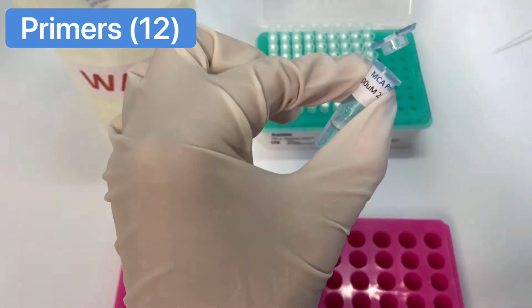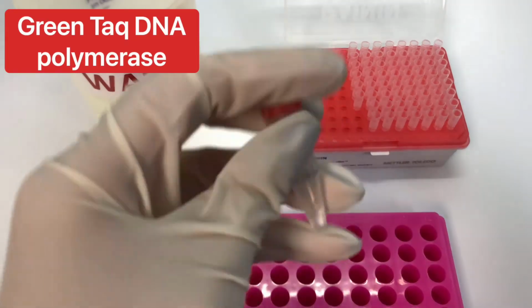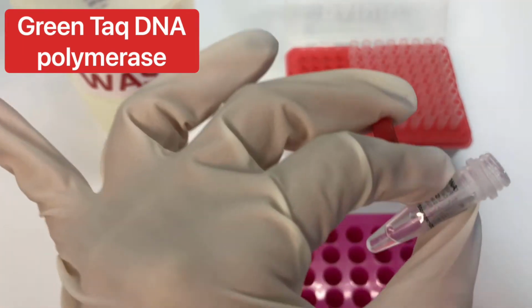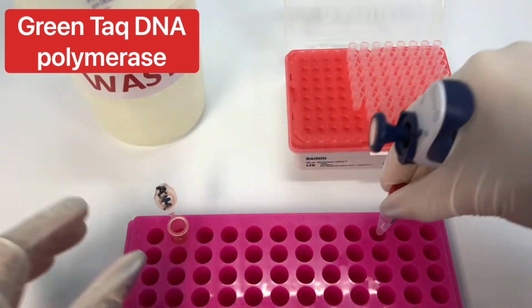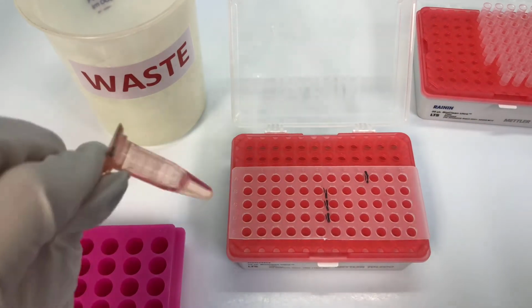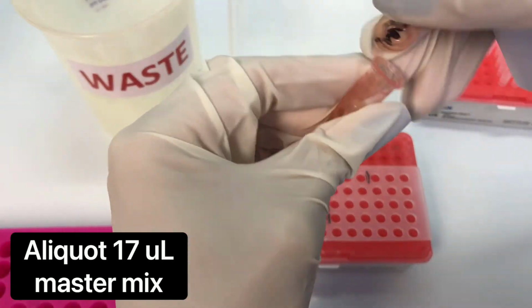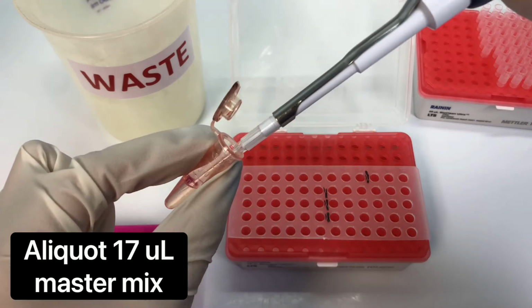This working solution actually contains 12 different primers. The final ingredient is the green Taq DNA polymerase. This liquid could be viscous, so you need to pipette up and down to mix. Invert the tube to mix. Aliquot 17 microliters of the master mix into a new PCR plate.